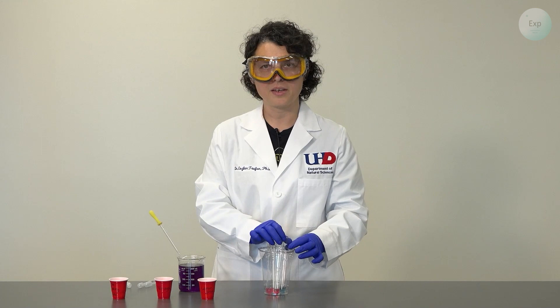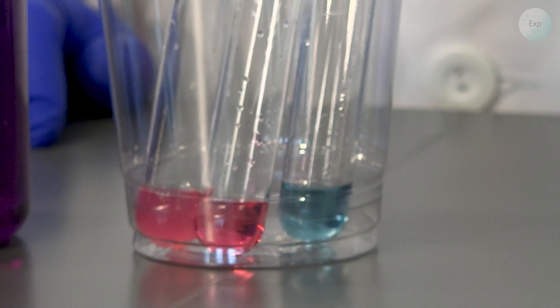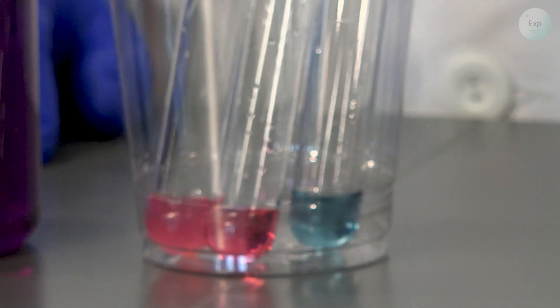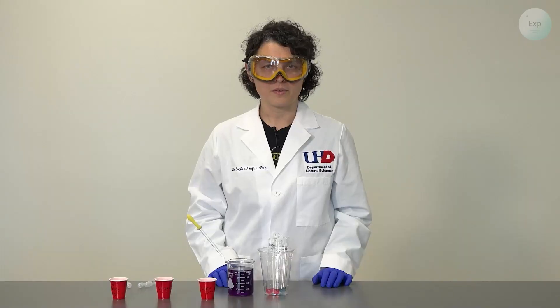If I were to test the pH of water, it would likely be the same color as my indicator solution, except maybe a little lighter, because I am diluting my indicator solution with more water that was already in.